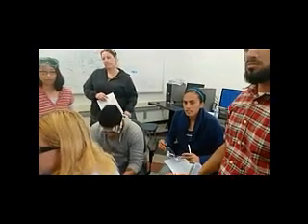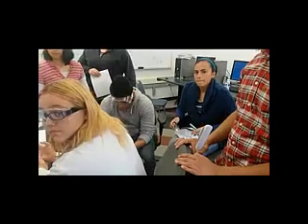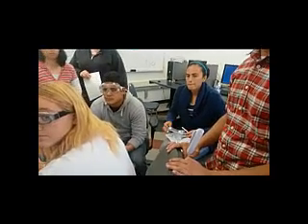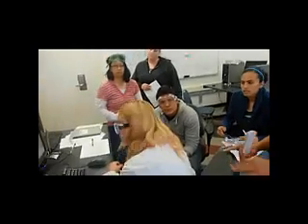It is meant for if something was to happen, say, a power outage or the hard drive just crashed. It's been backed up. Edgar set that up first, so it's supposed to repeat. It's supposed to back itself up almost every day. So every 24 hours it backs up, next day it backs up again, so you're never going to lose this stuff. The data will always be there.